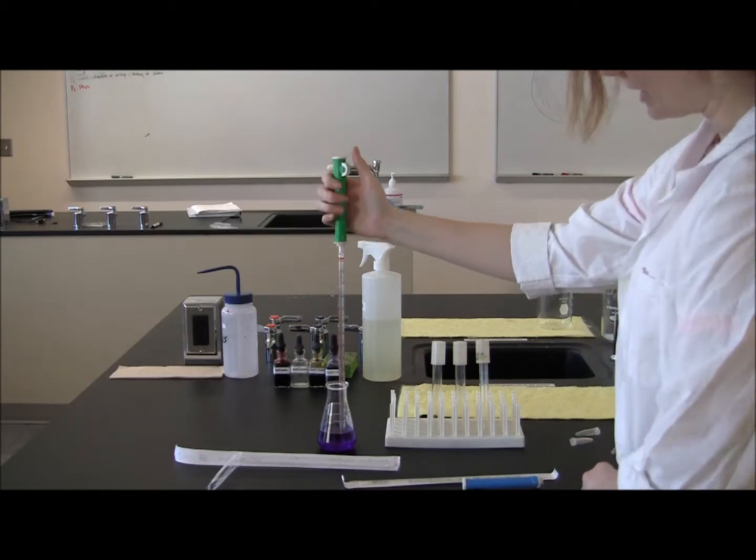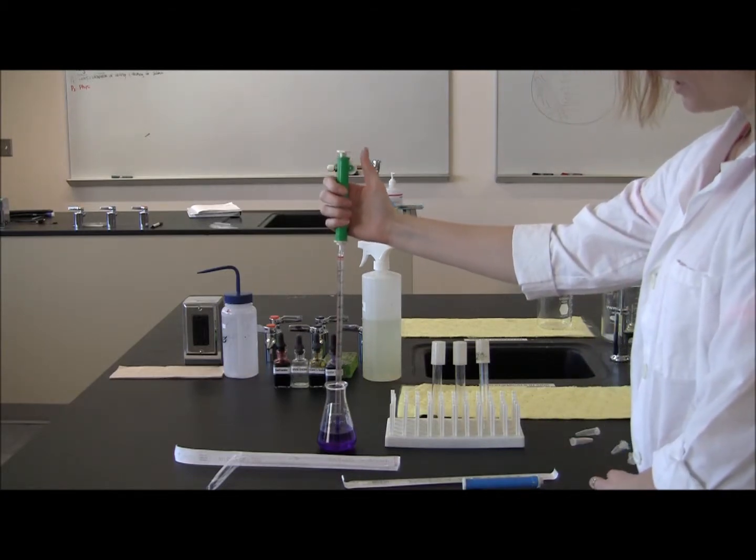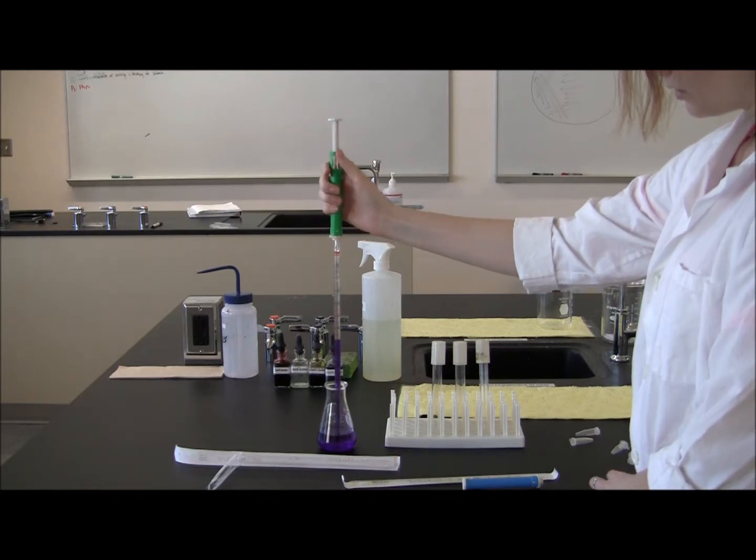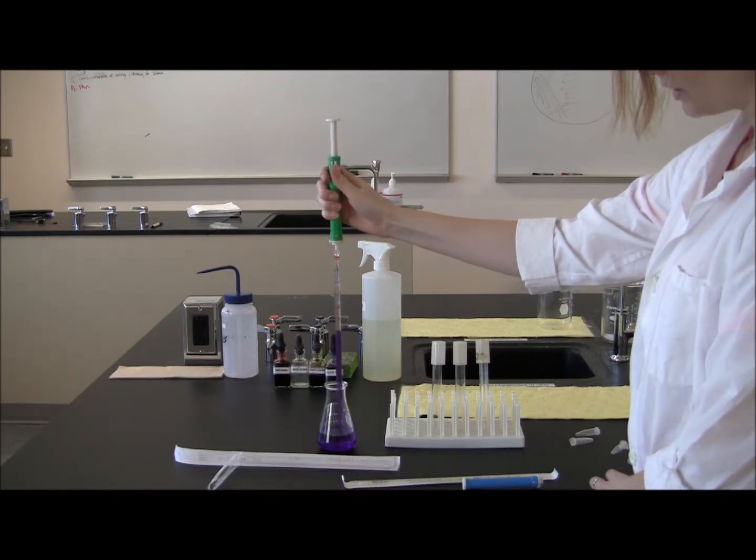And now this roll here is what you use to pipet the liquid up. So you pipet up to your specific volume that you need.